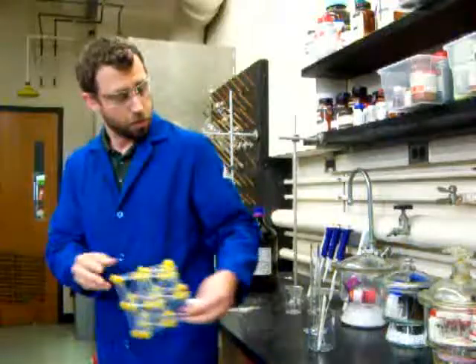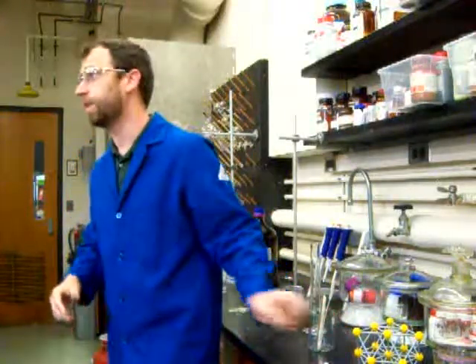So today, what we're going to show you is the synthesis of the metal-organic framework that we work with in our lab. The framework is called copper 1,3,5-benzene tricarboxylate. I realize that name is a bit of a mouthful, so instead of using that, we're going to call it by its more colloquial name, HKUST-1. And with that, let's go to Katie, who's going to show us how we actually make these materials.